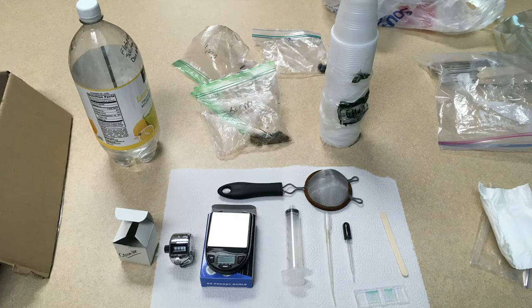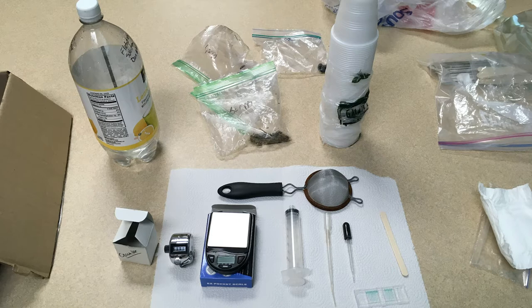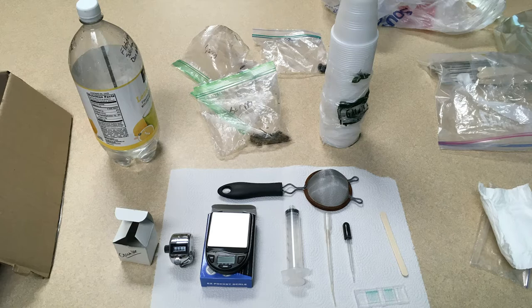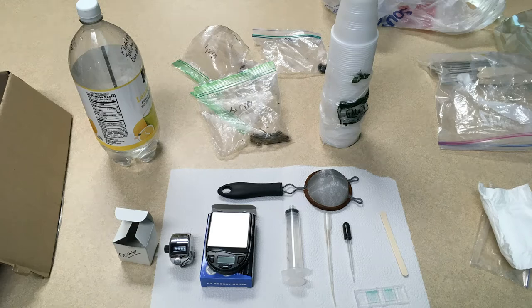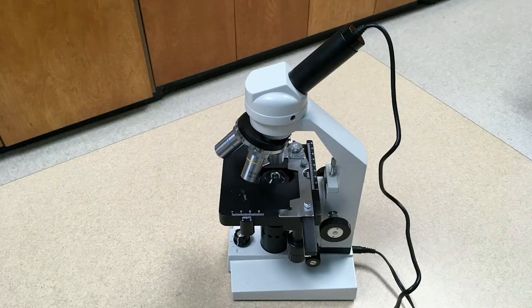In order to do a fecal egg count, some of the things you'll need include flotation solution, a counter, gram scale, tea strainer, pipettes and popsicle sticks, a 30 milliliter syringe, McMaster slides, some disposable cups, and of course, a microscope.